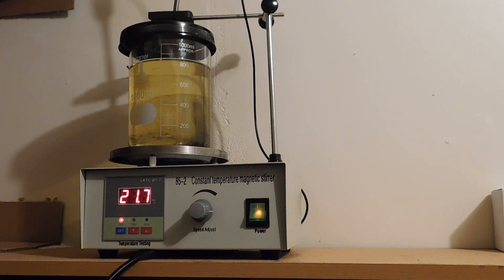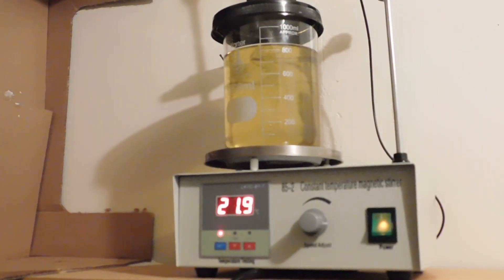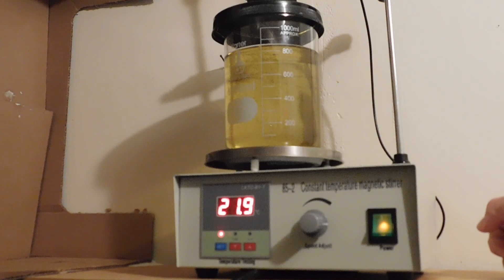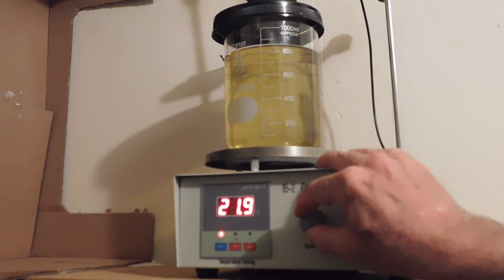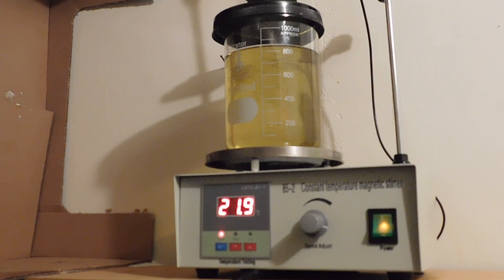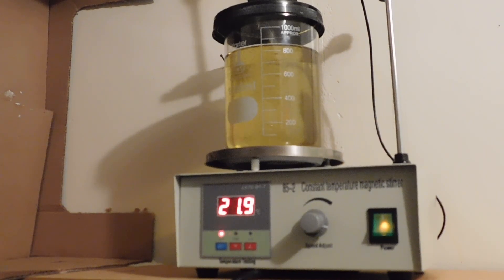And boom. Oh, come on. You can focus. Oh, why won't you focus? Now, in theory, you want to try to get it to where it forms a whirlpool at the top. And then drop it just below that. And that's maxed out there. So I don't know how well it's showing, but it's vigorously stirring. And my cat is walking all over the place in here.